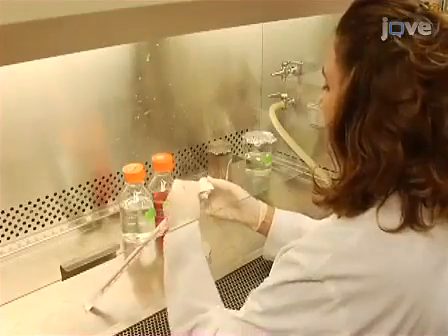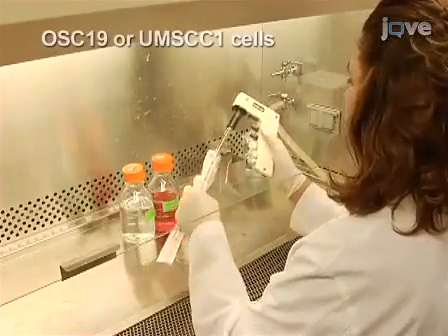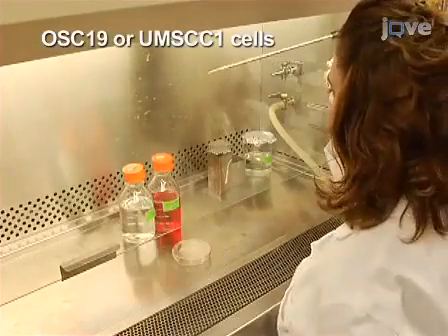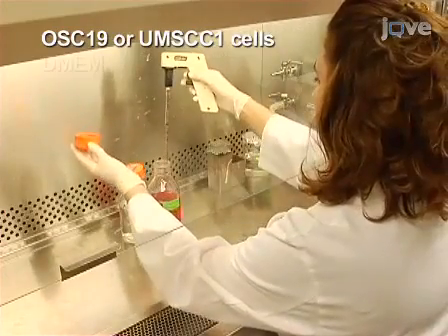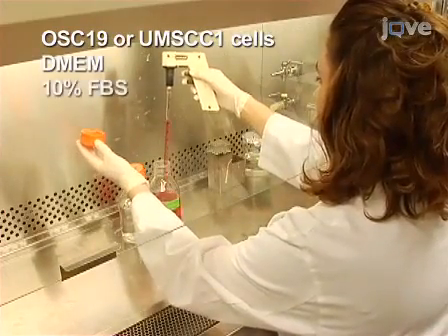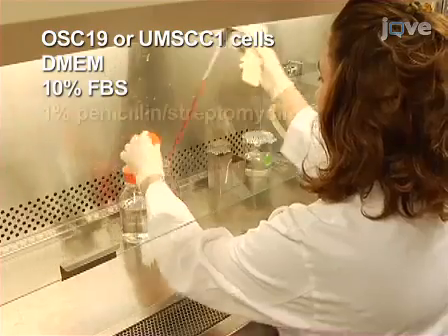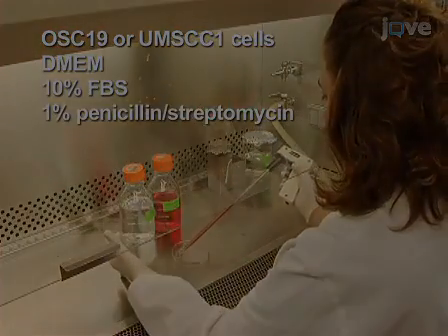To begin, culture human head and neck tumor cell lines in complete medium consisting of DMEM supplemented with 10% FBS and 1% penicillin-streptomycin.